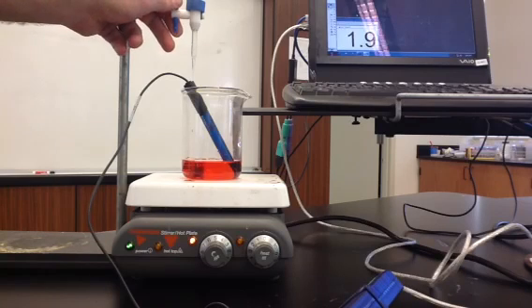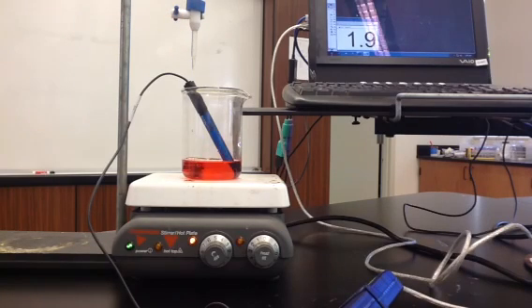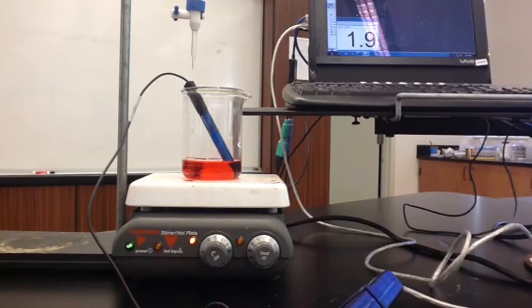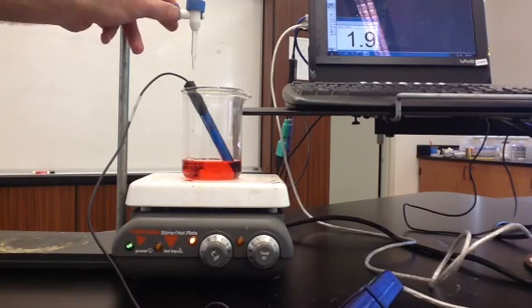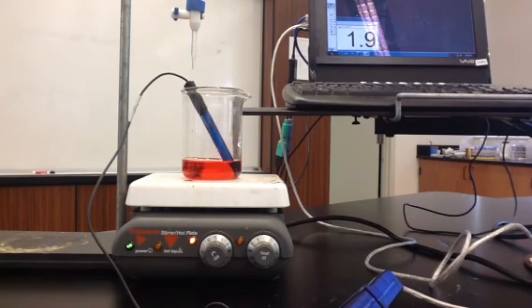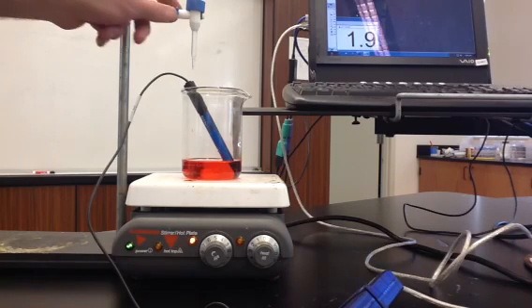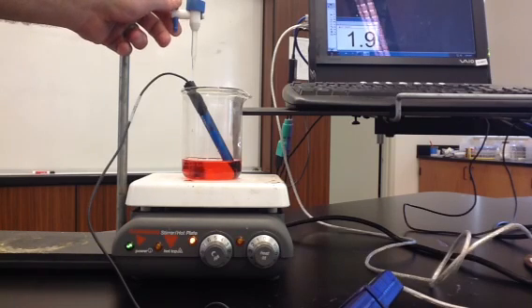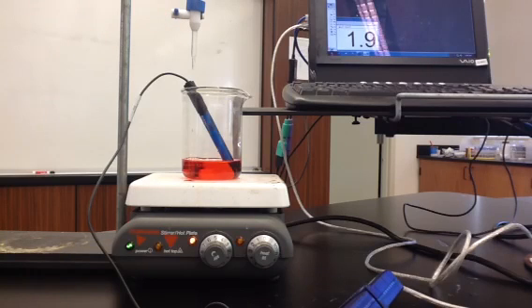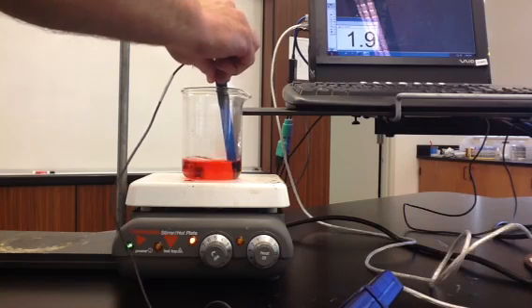So I'll open the valve and add one milliliter. After one milliliter has been added, we see that the pH is still 1.9 and the color is still red. So we'll add another milliliter. Two milliliters of sodium hydroxide have been added — pH has not changed yet. We've now added three milliliters of the base, sodium hydroxide, and our pH remains the same.